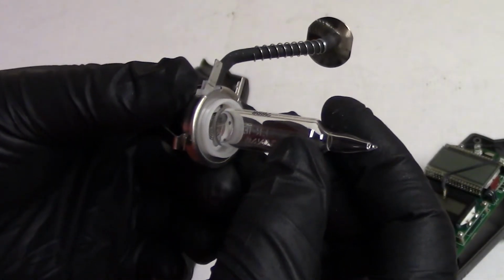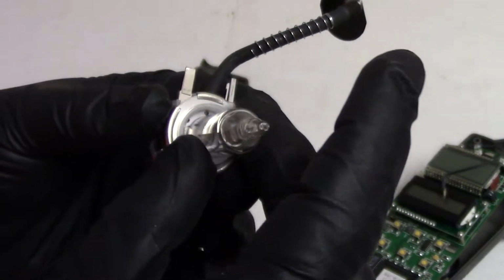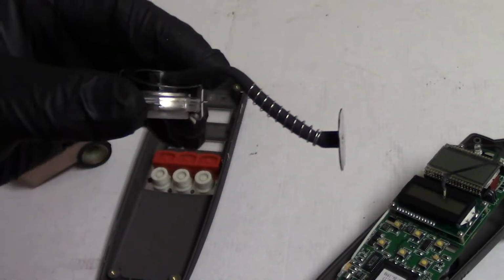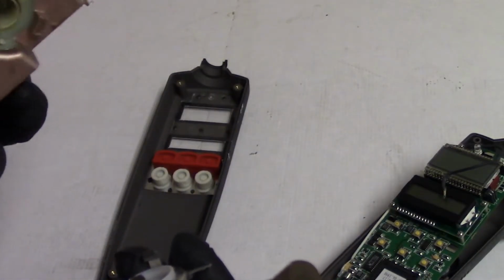So the tube is probably excited, it glows its UV light, and then causes the gases to be ionized, the sample gases, and then measured. So that's the whole measurement assembly right here. So I'm going to actually put that back on.